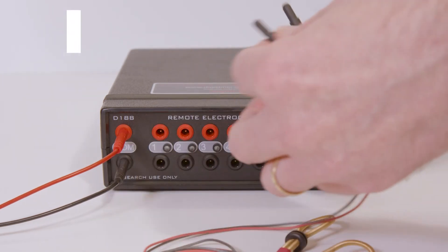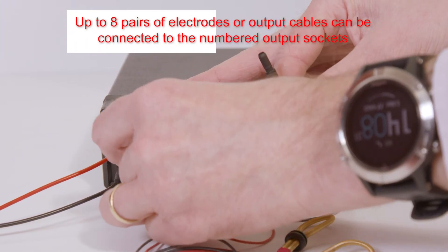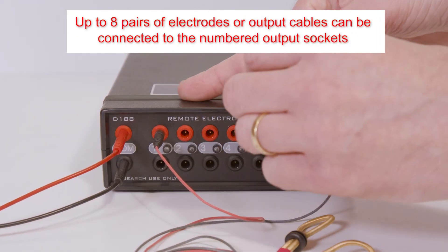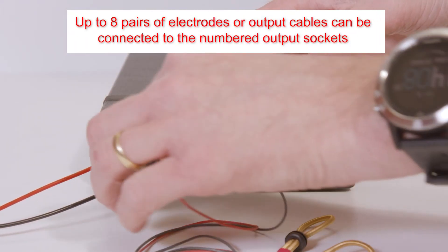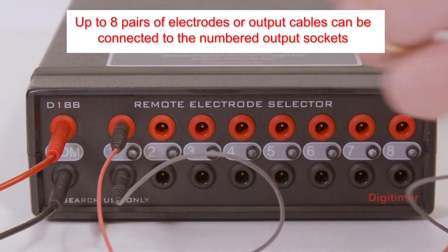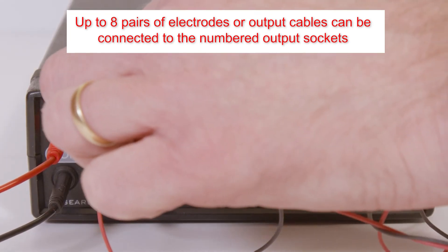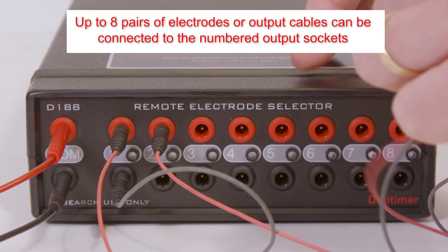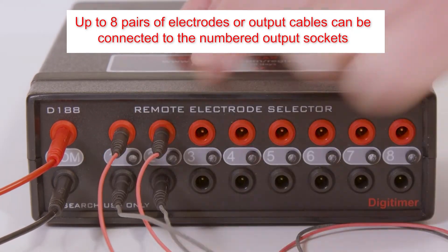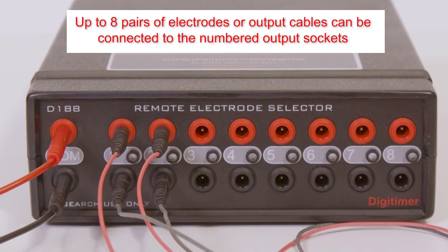The D188 can support up to eight different stimulation sites. Electrodes or electrode extension cables should be connected to the pairs of numbered output sockets.